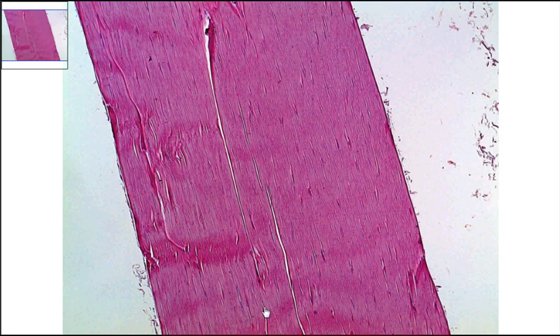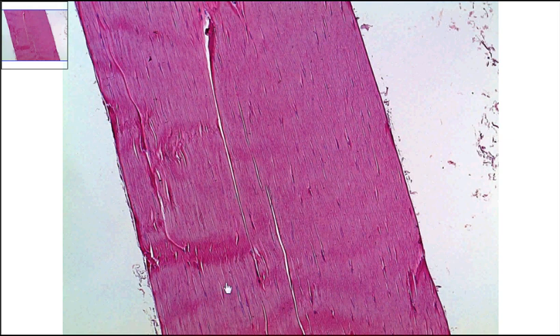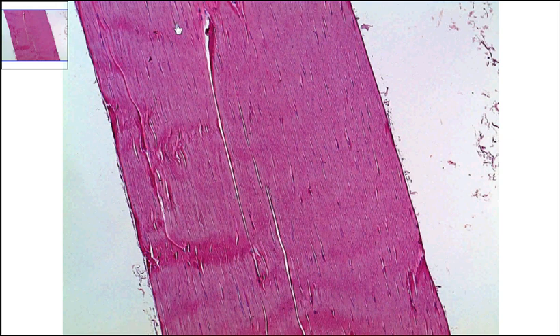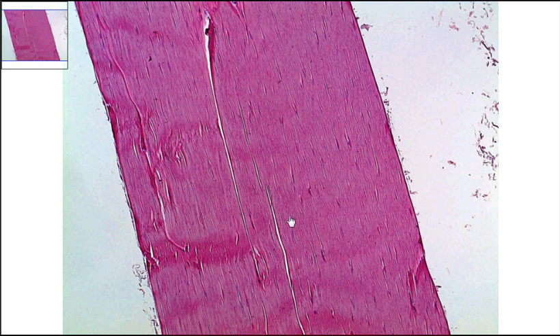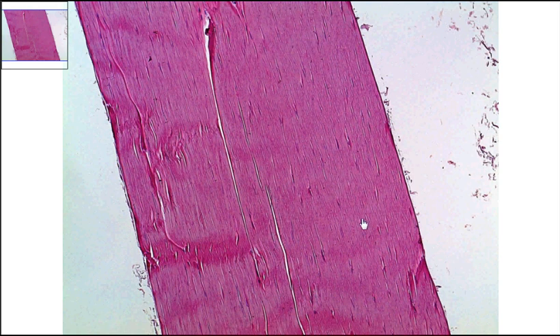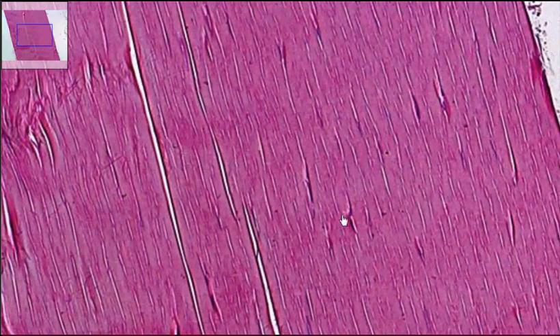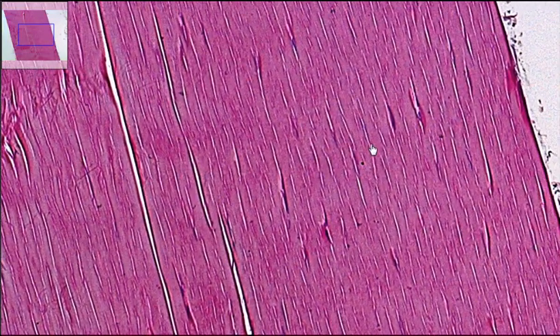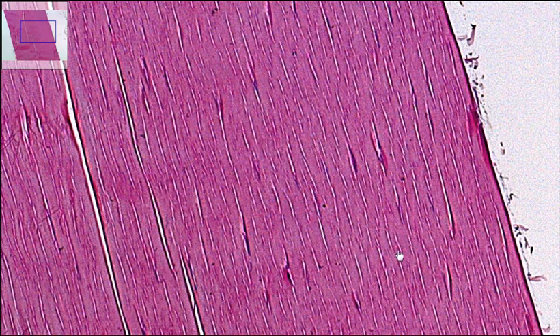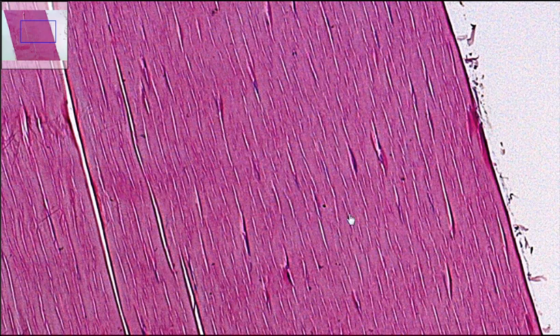If we look right now, can you see any pattern on the tissue? Hopefully you're noticing that all these lines are parallel. So if we zoom in, you can see all these parallel fibers. There are the fibers — we have one component identified.